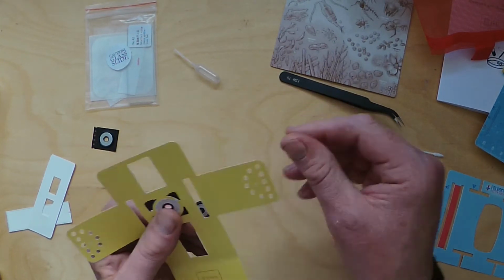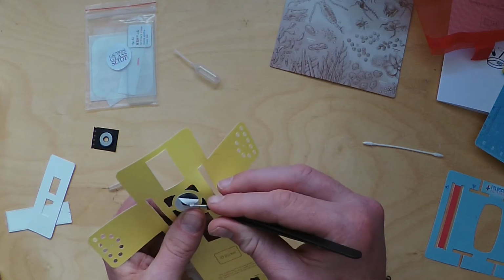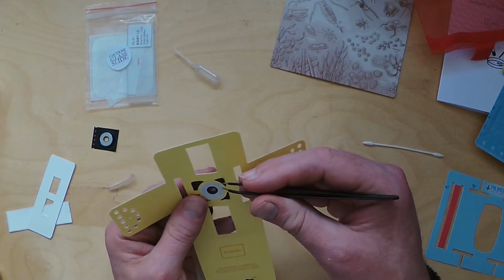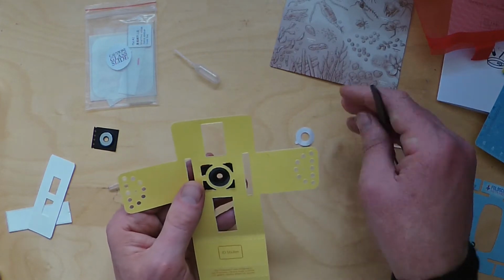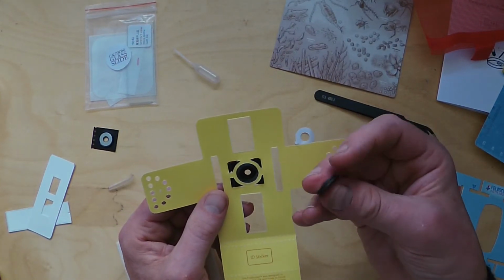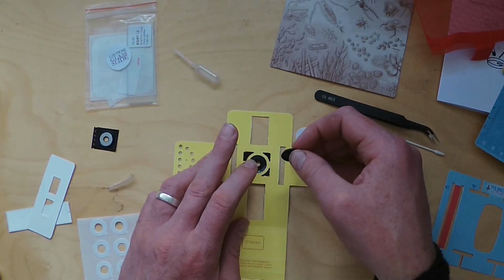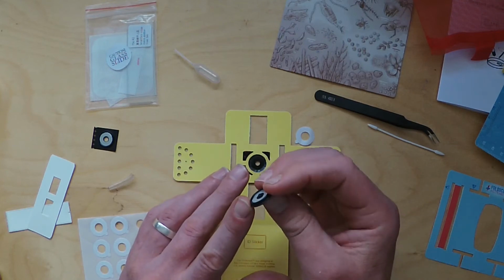Okay, and you'll see there's a tiny little tab there. You'd be able to just take the tab with the sticker fully stuck on, grab that tab either with your nail or with the tweezers, peel that off. Okay, so now that's quite sticky. You want to take your lens, flip it over because you want the bump side down. So with your yellow side up, your sticker on this part of the lens holder, you want to place this bump, that's the sort of nipple side, down.